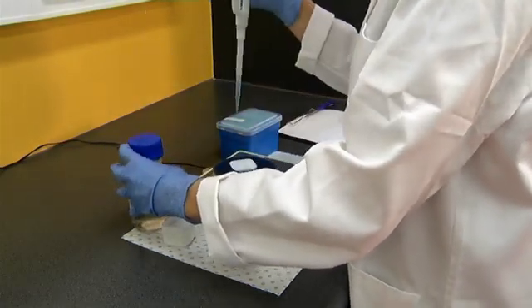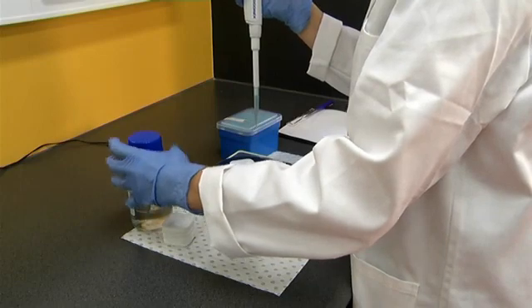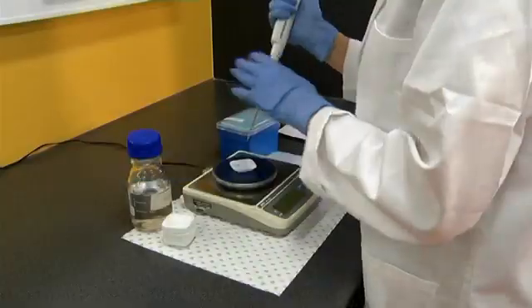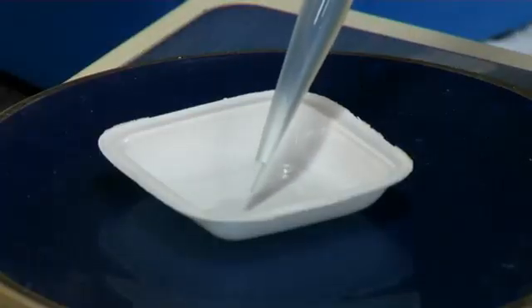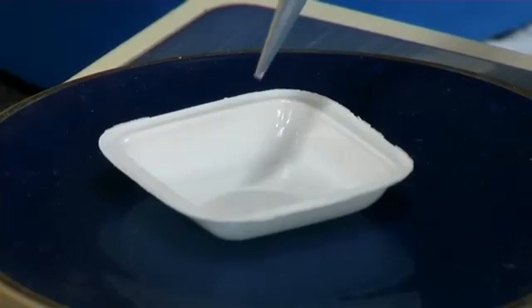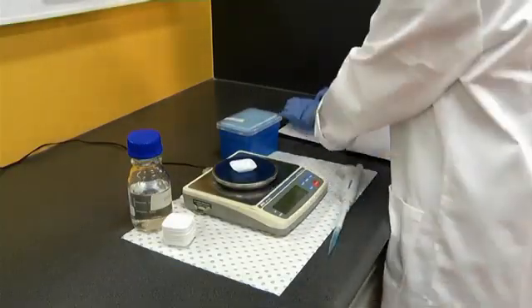To check the accuracy and precision of your pipetting, pipet some water into a weigh tray on a tared analytical balance. Repeat this 3 times and record your results.